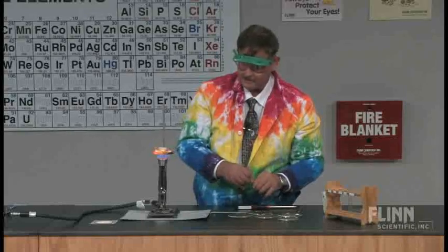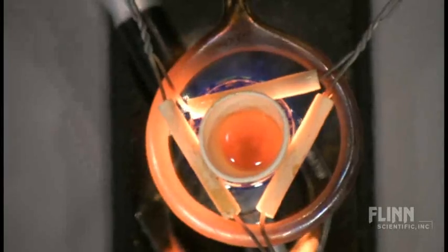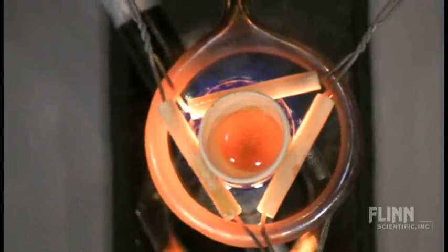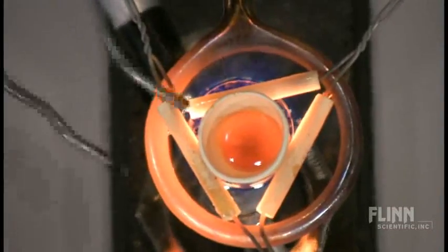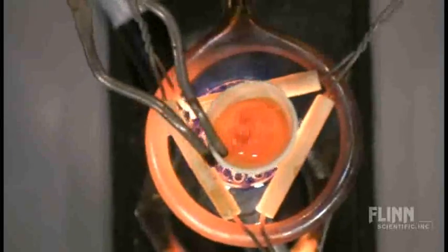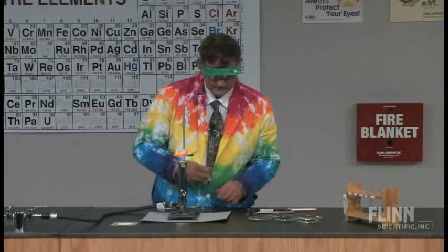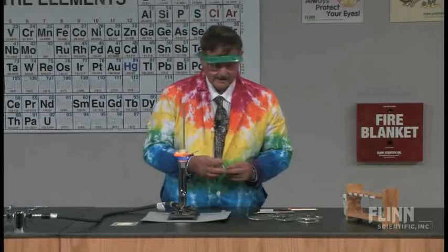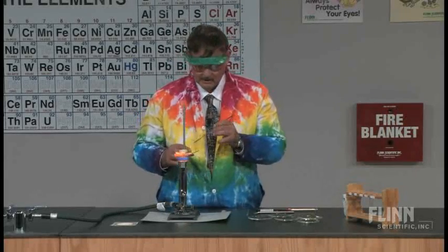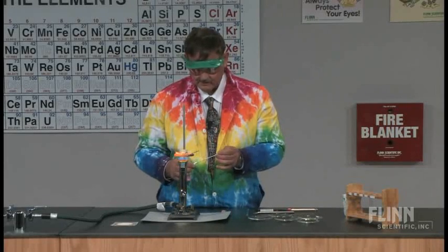All right. And I'm going to take a small amount of that, and I'm going to add it to my plain glass. Looking down on this, you can see that the glass is melted, and if I take the crucible tongs and give it a little shake, you can see that it's liquidy. Okay? So I'm going to go ahead and add a little bit of manganese. And again, you do not have to add very much to this. This is about 10 grams of material, and I'm just going to add a small pinch. And by small, I mean small.